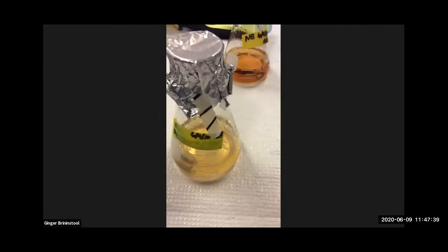So this was nutrient broth that we made last section. And see my label, do you know why that happened? Because I accidentally made a mess. But this is nutrient agar. You can kind of see the remains of NA left there. And I didn't fix the label before I autoclaved it. So this is nutrient agar. If I let this cool here, it'll just be a chunk of agar in the flask. You don't want to do that. That's never good policy. So I'm going to take this and put it on the lab bench.